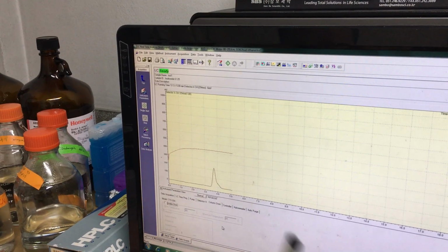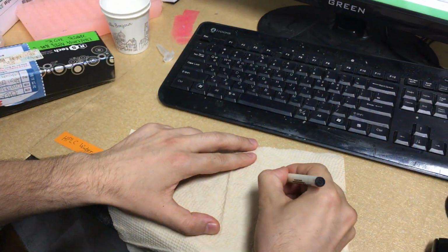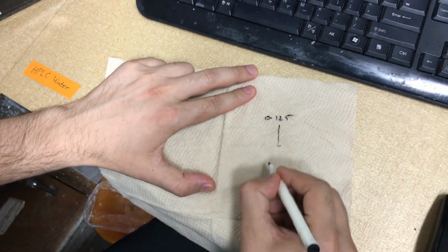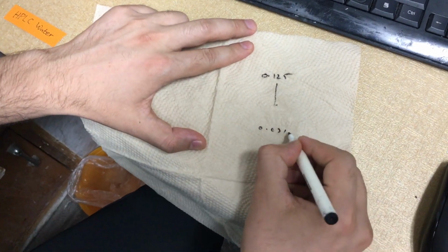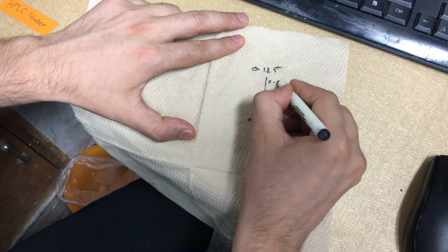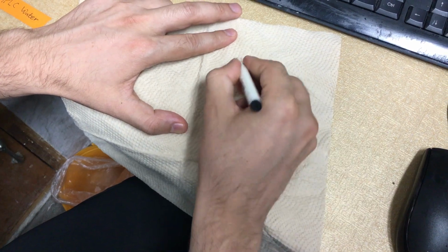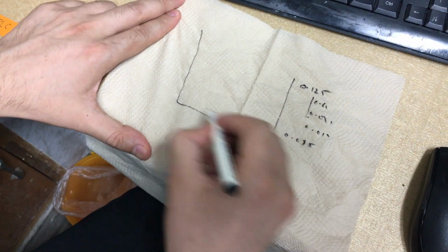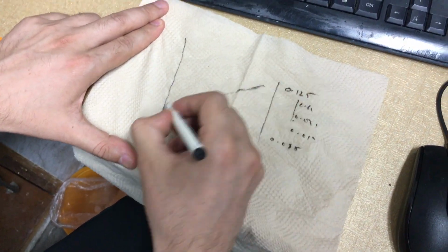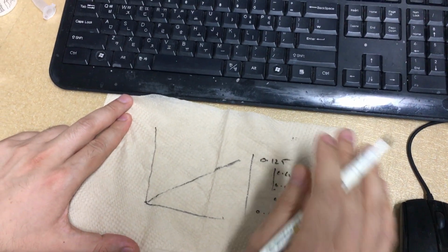So this is my standard, and for standard you need 5-6 standards, like from the maximum, like this was 0.125, then 0.062, 0.031, 0.015 microgram. This will be your standard. From this standard we will get a standard curve in Excel. Okay. So you mean this is the concentration? So this one you will do 5 or 7 dilutions of pure drug, whatever is your drug.